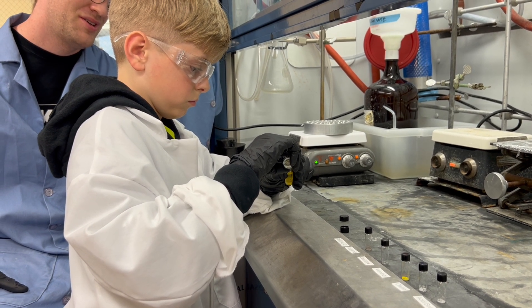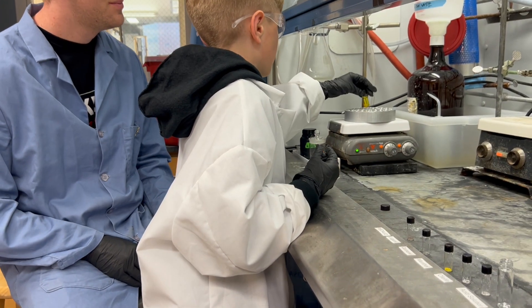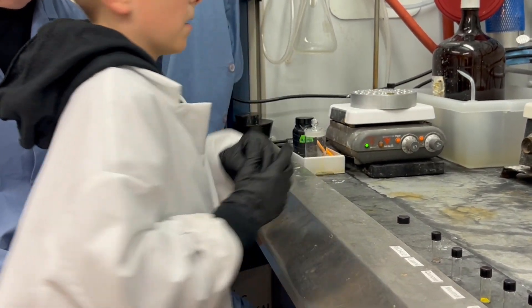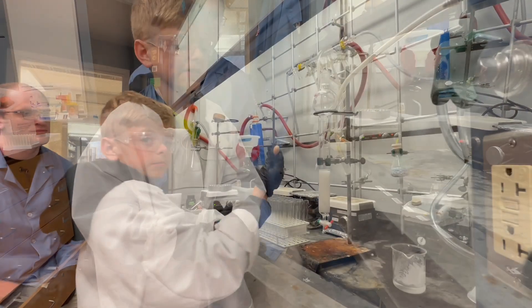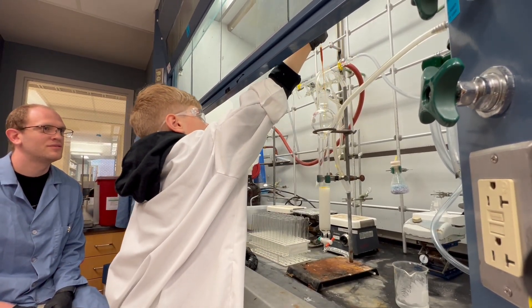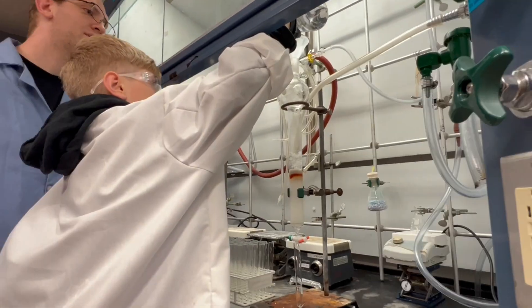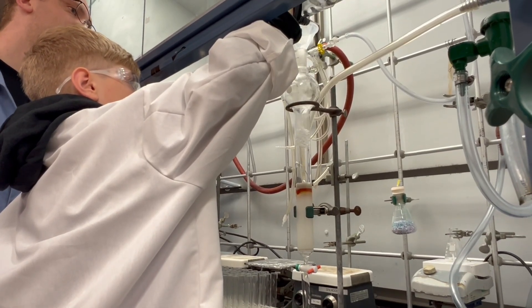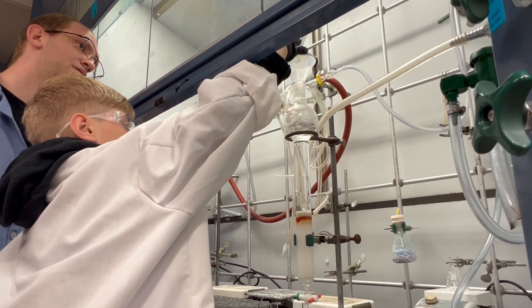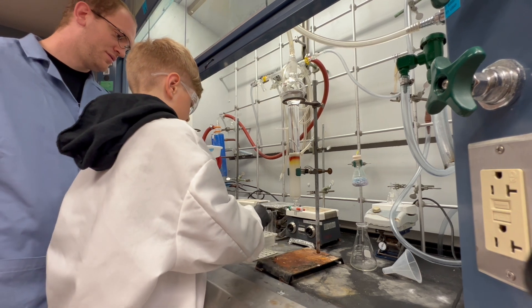Then we add a magnetic stir bar that keeps everything mixing well — don't forget to add your magnetic stir bar. And then we heat the reaction up and let it stir for 48 hours. After 48 hours, we let the reaction cool down. While it is cooling down, we set up a column that allows us to separate the different parts of the reaction from the desired ether product. Another thing that makes this reaction so easy is that you do not need to do an aqueous workup or any workup — you can just do chromatography.